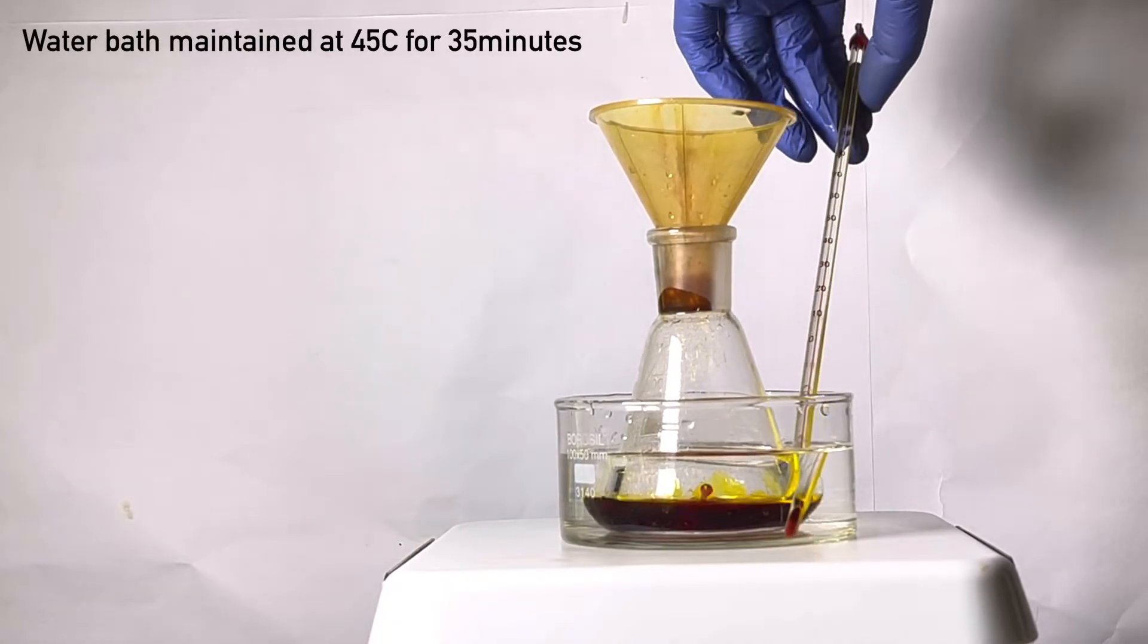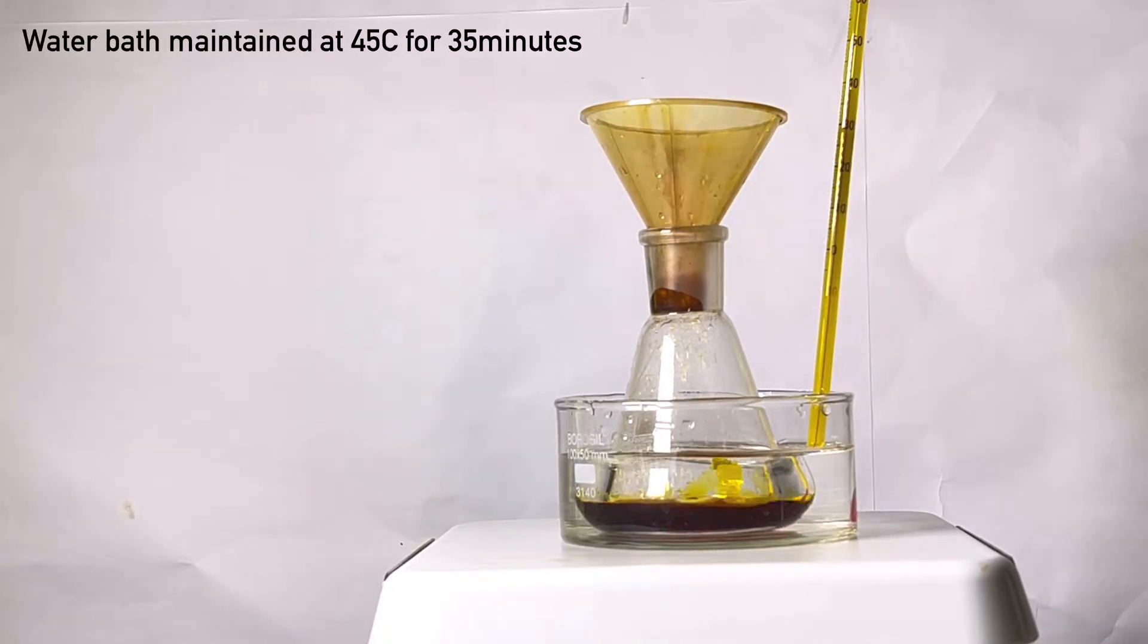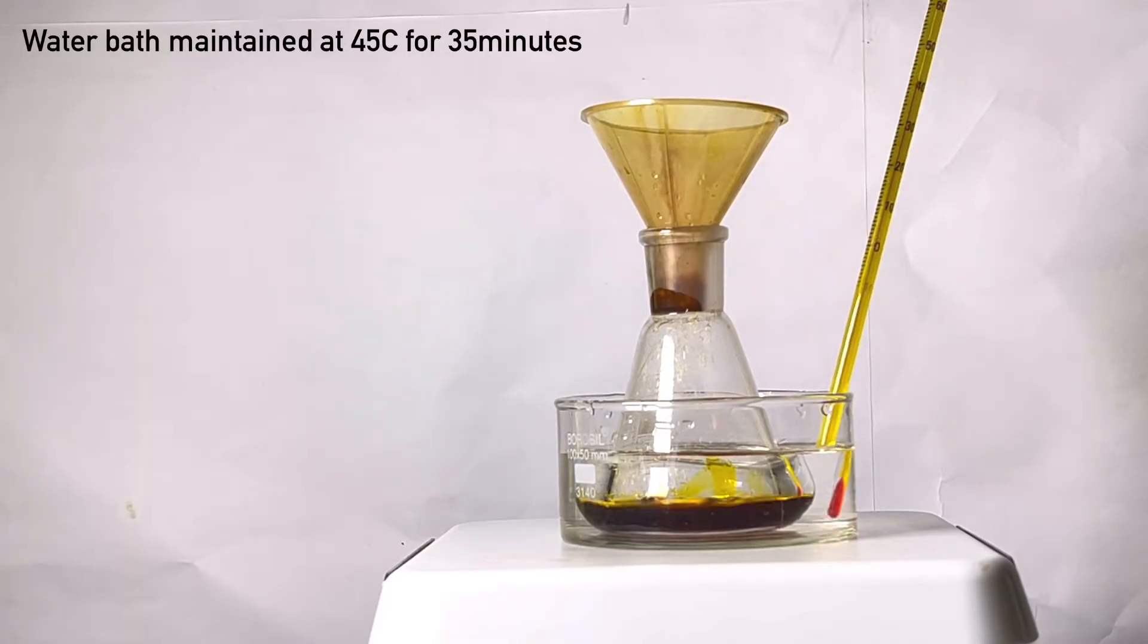The temperature of the water bath is maintained at 40 to 45 degrees Celsius for around 35 minutes.